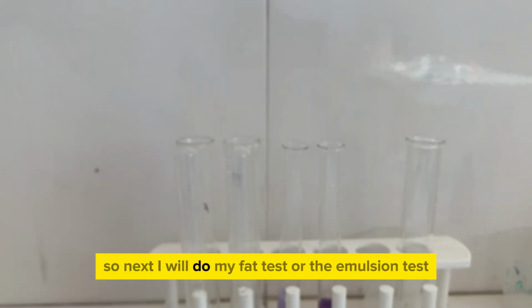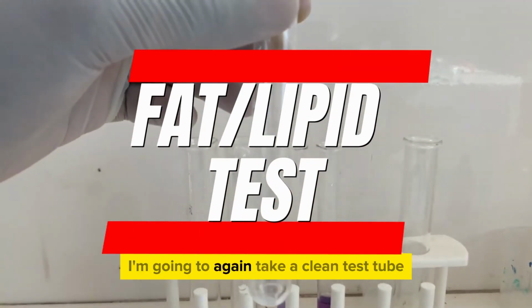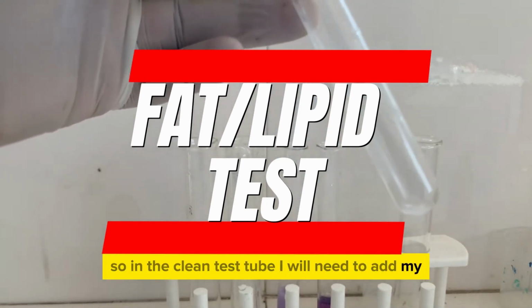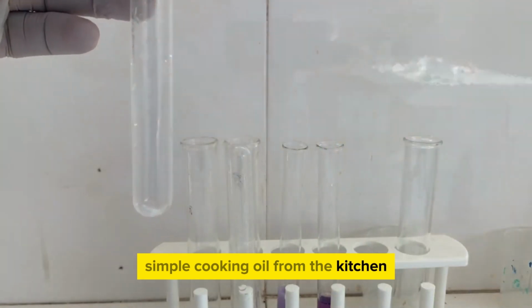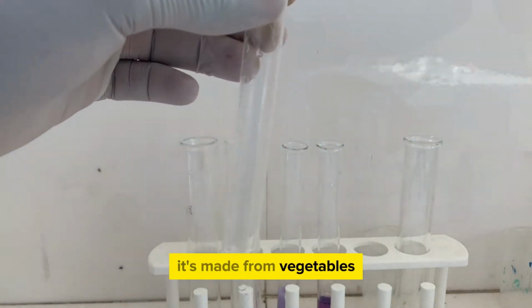So next I will do my fat test, or the emulsion test. I'm going to again take a clean test tube. So in the clean test tube, I will need to add my sample of oil. In this case, I will use simple cooking oil from the kitchen. Here's my cooking oil. It's made from vegetables.